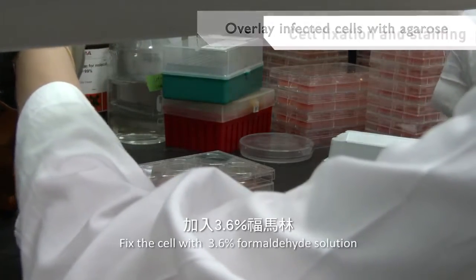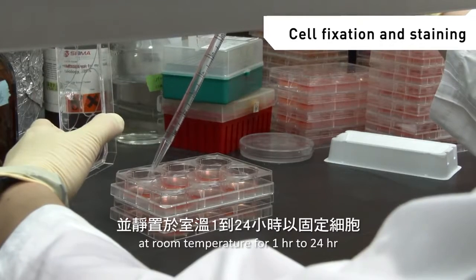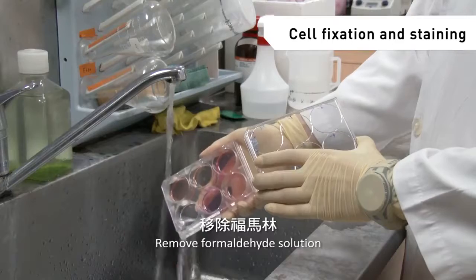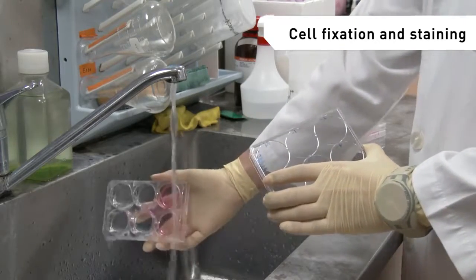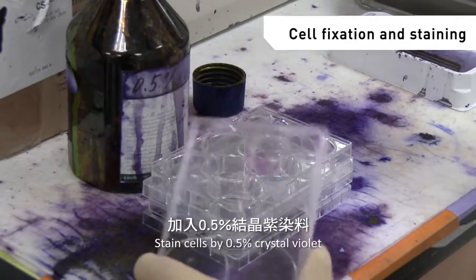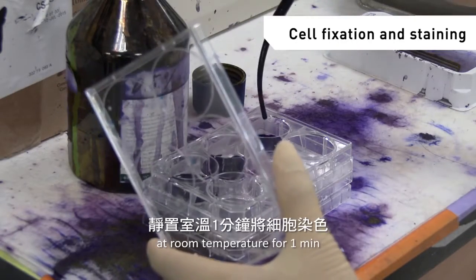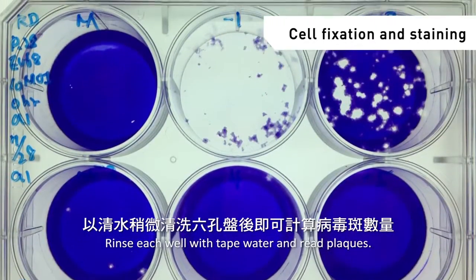Fix the cells with 3.6% formaldehyde solution at room temperature for 1 hour to 24 hours. Remove the formaldehyde solution, then wash out the agarose overlay. Stain cells with 0.5% crystal violet at room temperature for 1 minute. Rinse each well with tap water and count plaques.